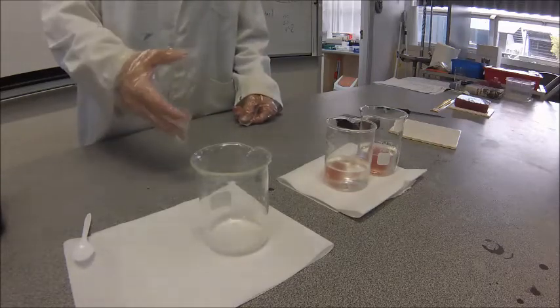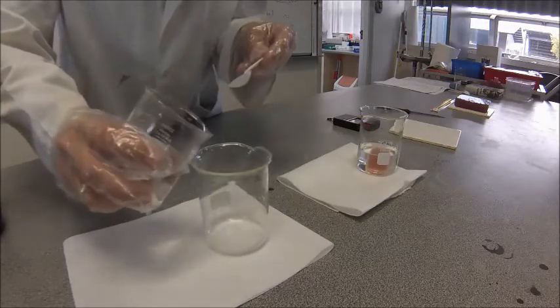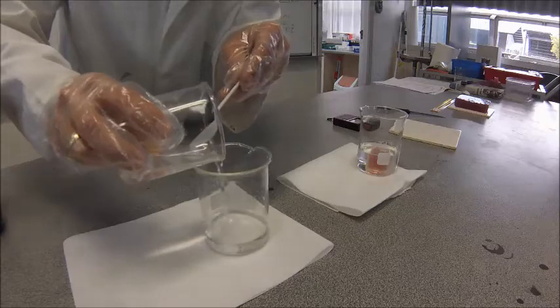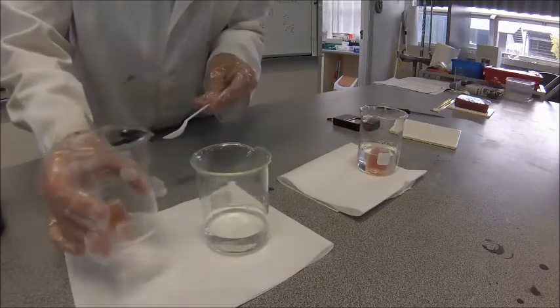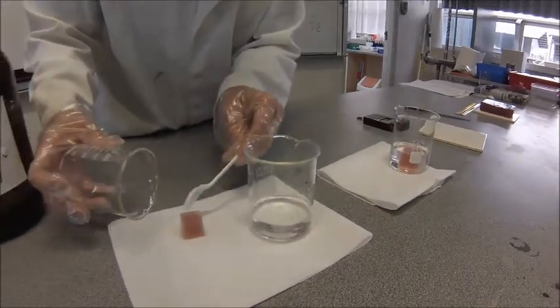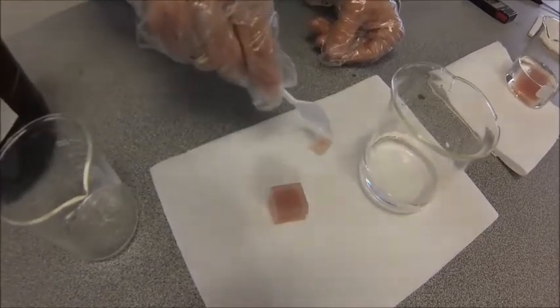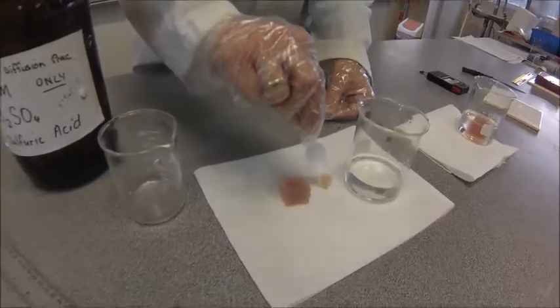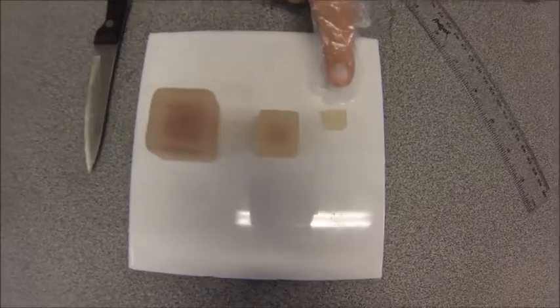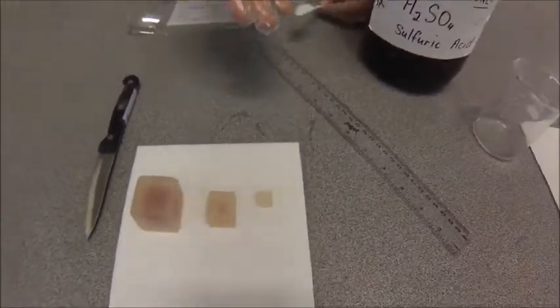After just under five minutes, we're going to extract the cubes to demonstrate. I'll pour off the acid using a beaker and spoon rather than pulling the cubes out by hand, since they can be a bit squishy and you might wreck them. Scoop them onto some paper and pat the surfaces dry, because any acid remaining on the surface will continue to diffuse in. If you leave them too long or don't pat them dry, the smaller cube can lose all its color completely, making it impossible to take measurements.